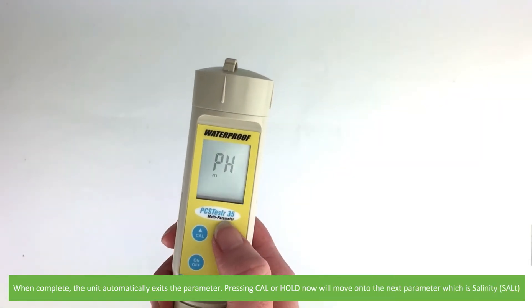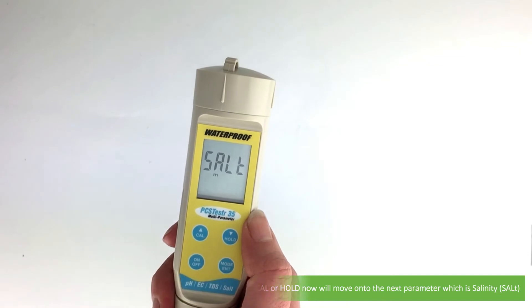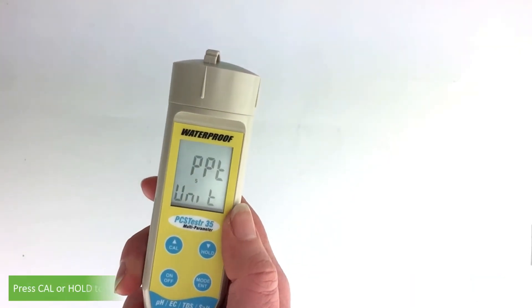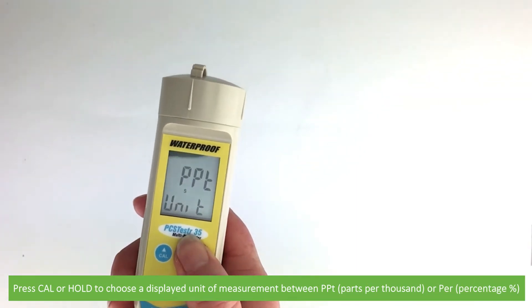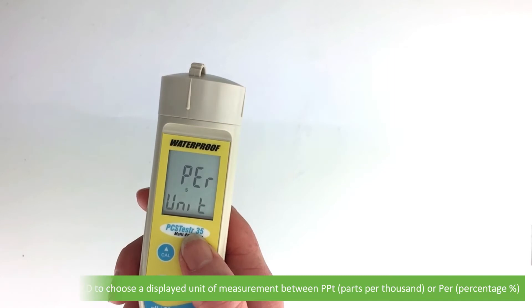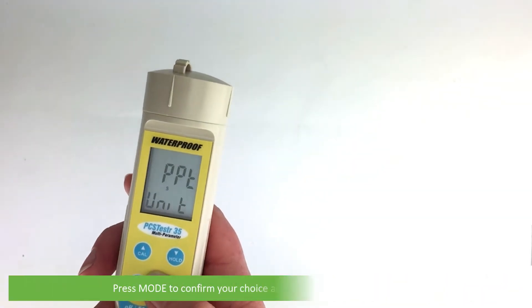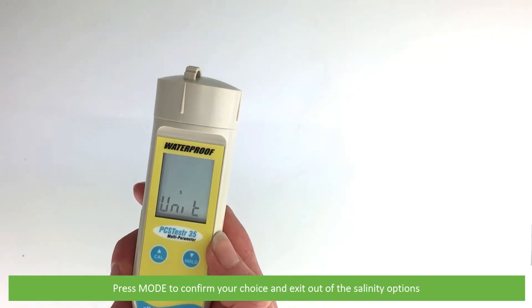Pressing cal or hold will move on to the next parameter, which is salinity. Press mode to enter into the salinity options. Press cal or hold to choose a displayed unit measurement between parts per thousand or percentage. Press mode to confirm your choice and exit out of the salinity options.